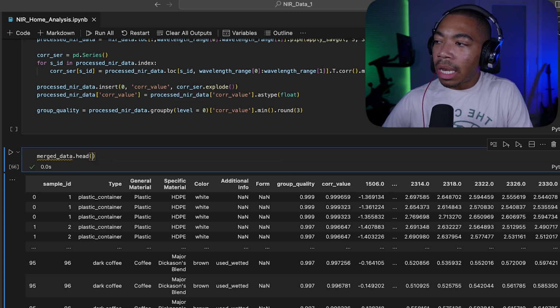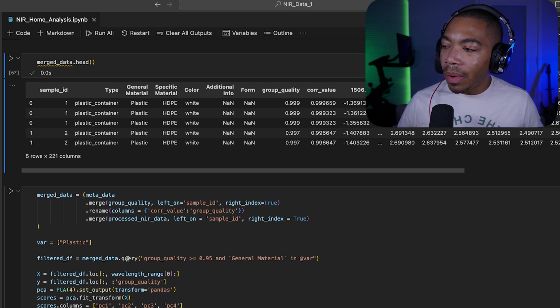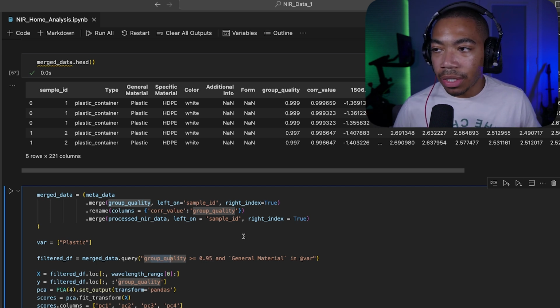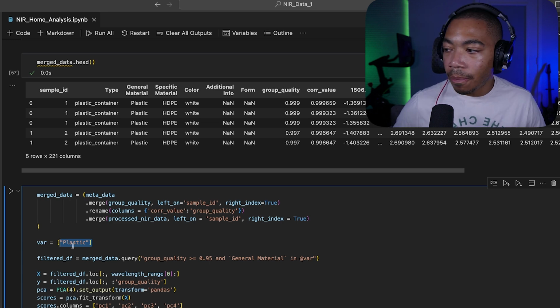So this data table will allow us to do quite a bit of work as we now begin looking for insights within this data table. Now, an important step in this is this query here, where we can look at group quality within merged data. And I have a statement here where we're going to look at the values that are greater than or equal to 0.95 correlation. So it's going to look in this group quality column, and also only filtering where we have general material equal to this var variable there. So we're focusing just on the plastics for this video.